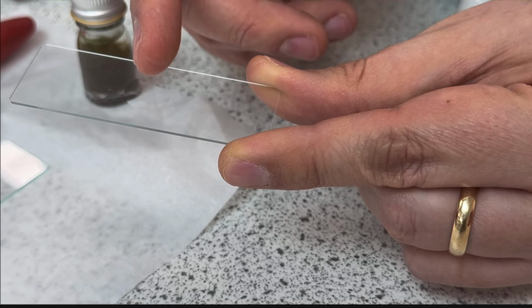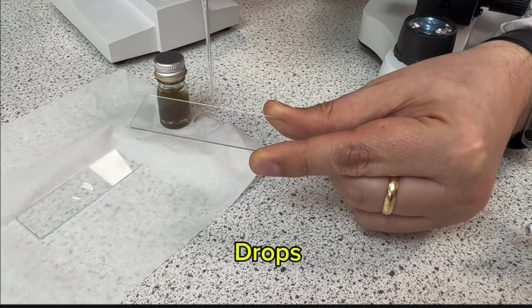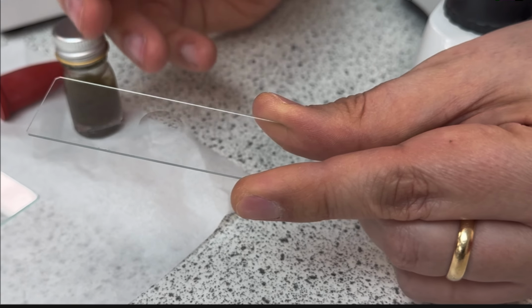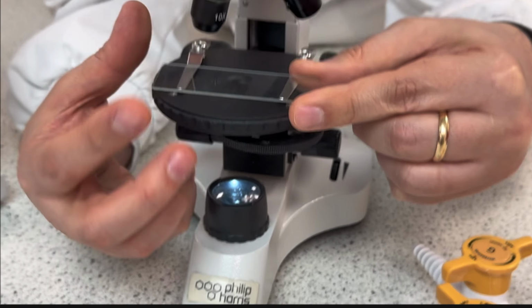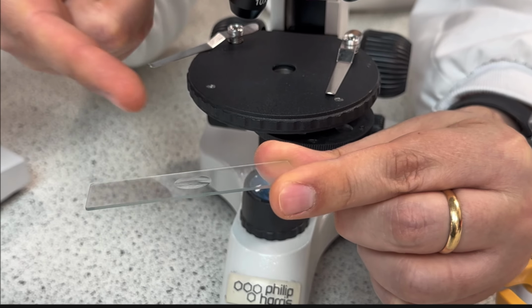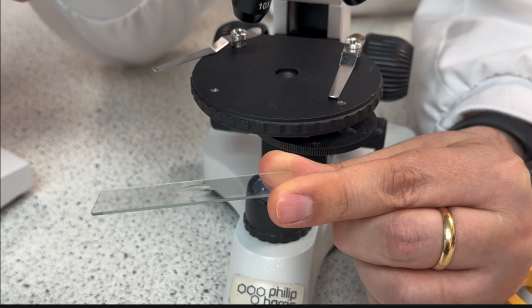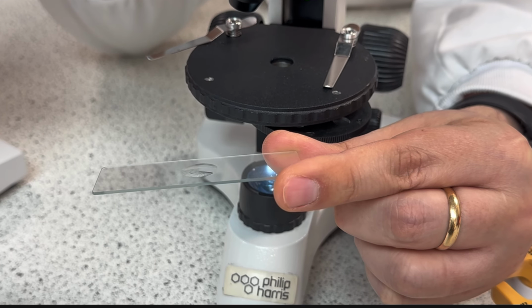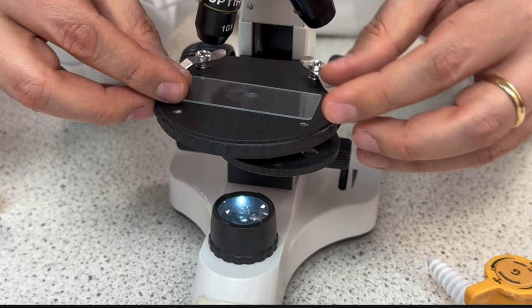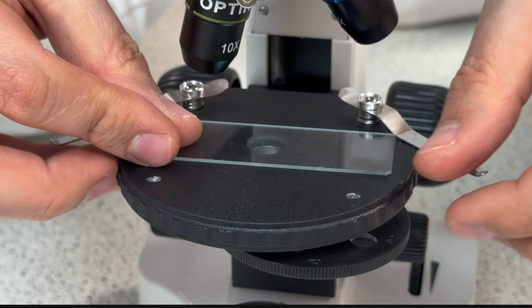Because in the cavity is where I'm going to place some drops of my sample. So what I will do is place my slide here. I just need to check if the cavity is facing up. How can I check? I just pass my finger on the top. If I feel it going down, this means the cavity is facing up. I'll place it here.